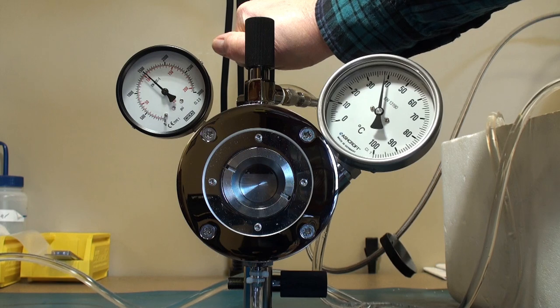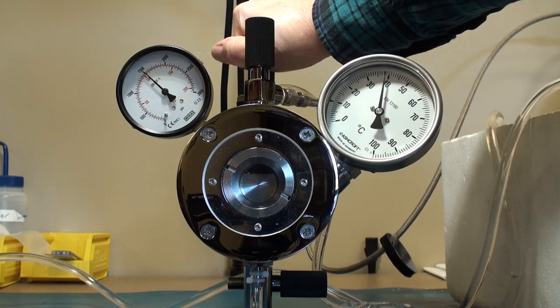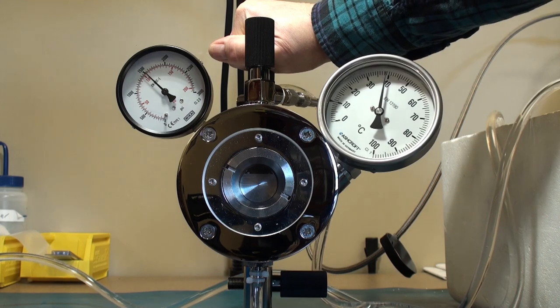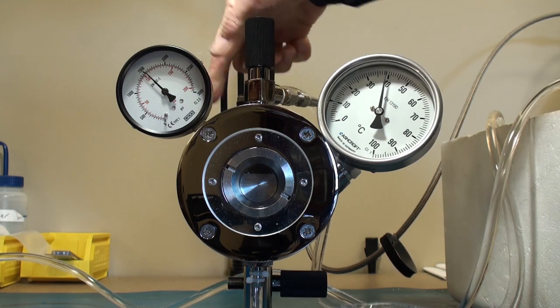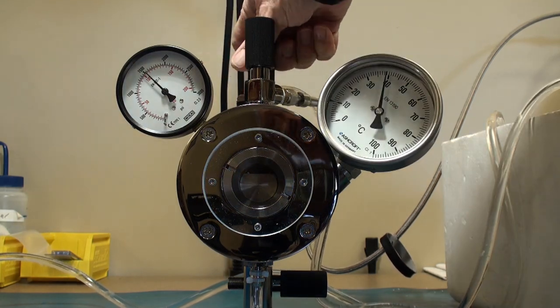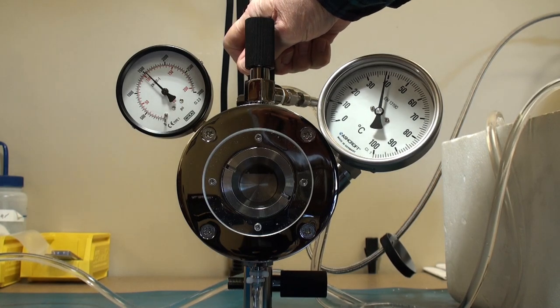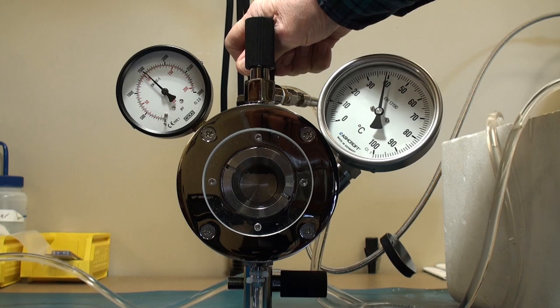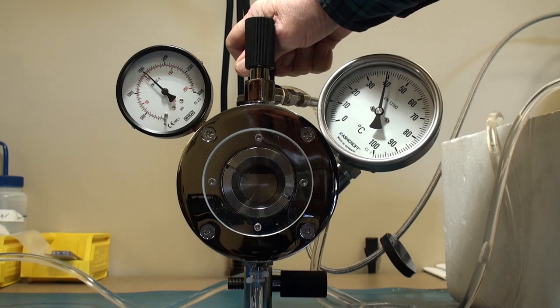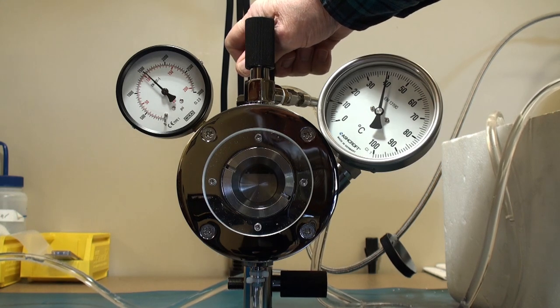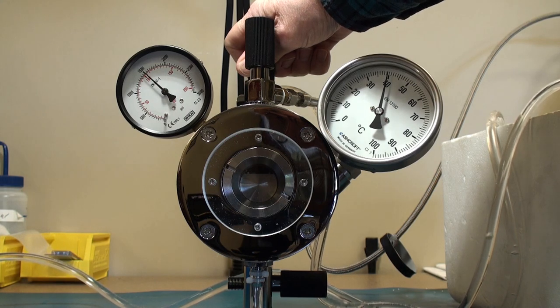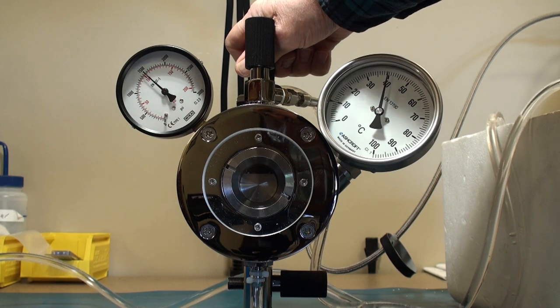So you will keep the temperature on the warm side. And now you will slowly, less than 100 PSI per minute, open the rear gas exhaust valve which you see my hand on behind the inlet valve. And you will slowly start releasing pressure while maintaining temperature. Now I am doing this a little bit more rapidly than I normally would.